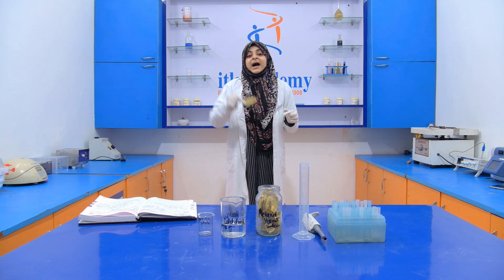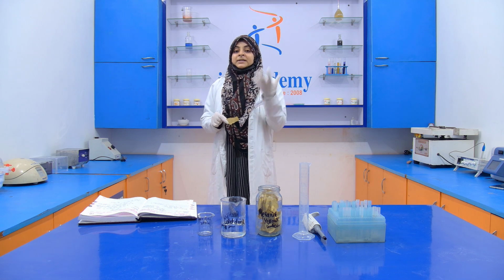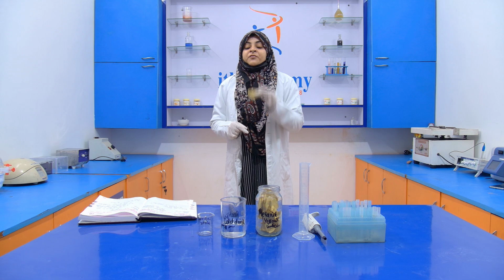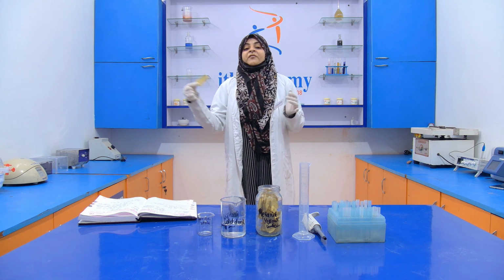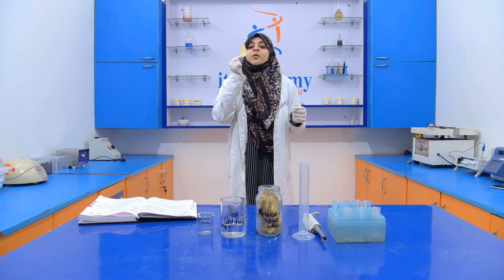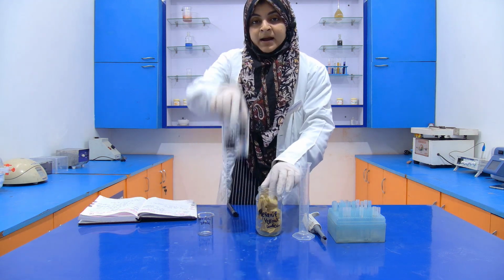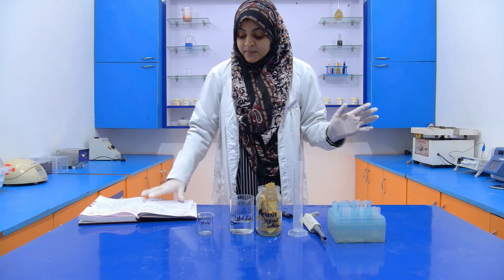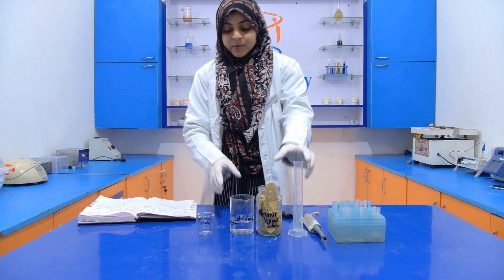After that, we take a strip of filter paper and dip it into this metanil yellow solution, and again we leave it for 5 minutes. Then we remove this strip of filter paper from the solution, and our metanil yellow indicator is ready. Then this is our carbonated beverage. This is our measuring cylinder that we require for performing this experiment. So simply, we take 10 ml of carbonated beverage.